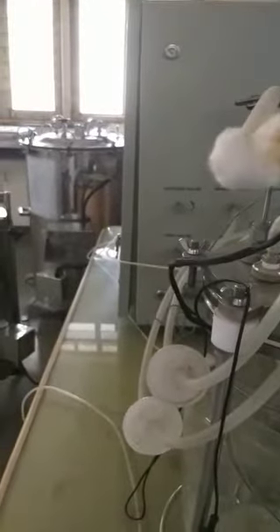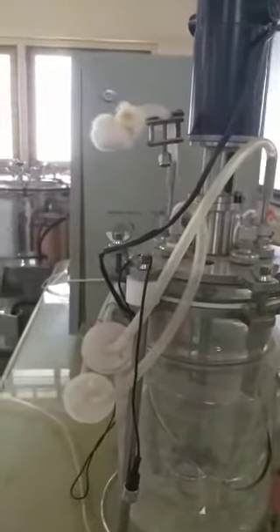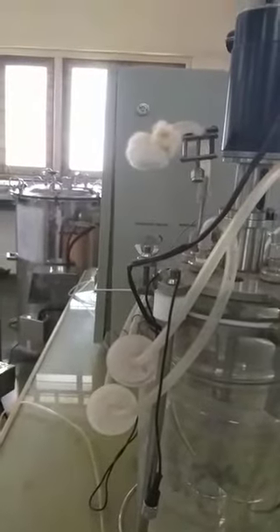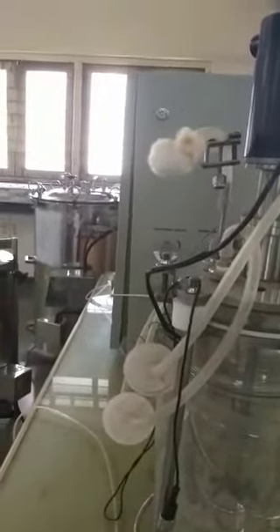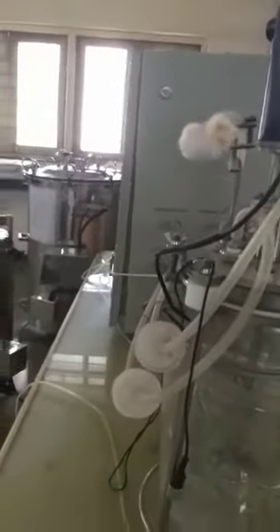Fill the vessels with media, making sure that the working volume does not exceed 75 percent. Sterilize the media in the autoclave before starting the actual process.